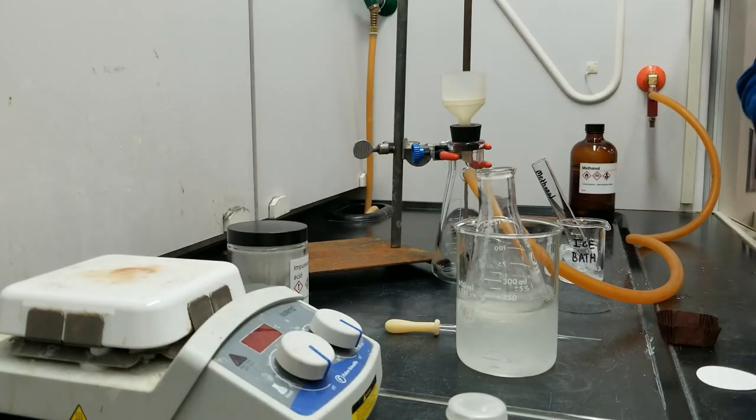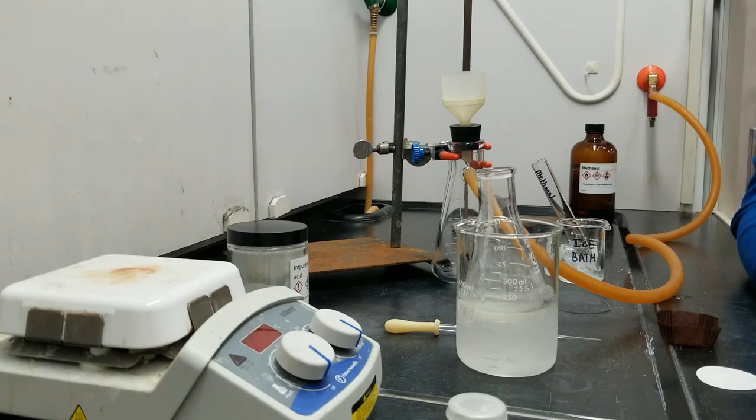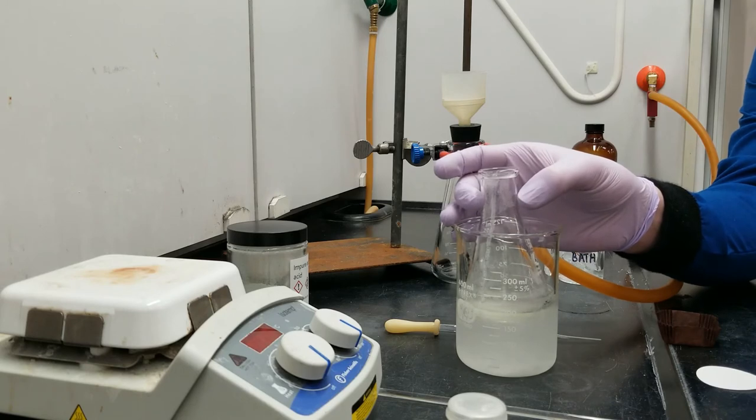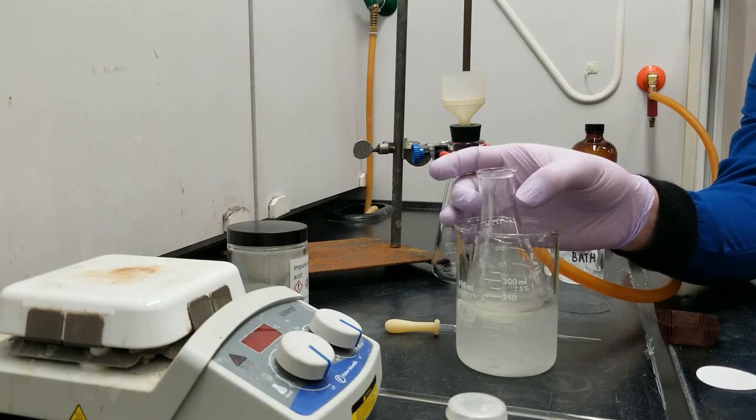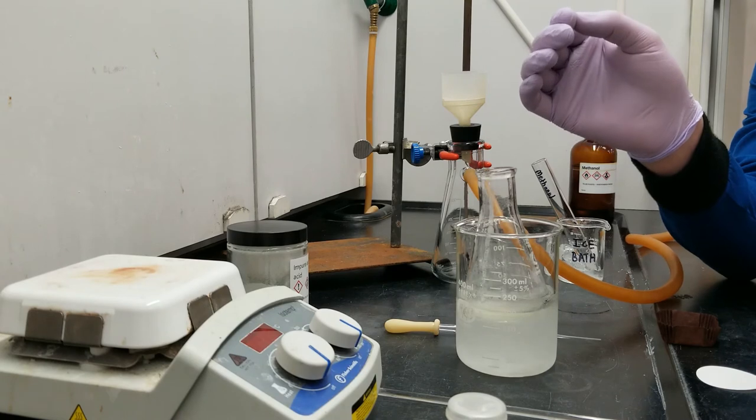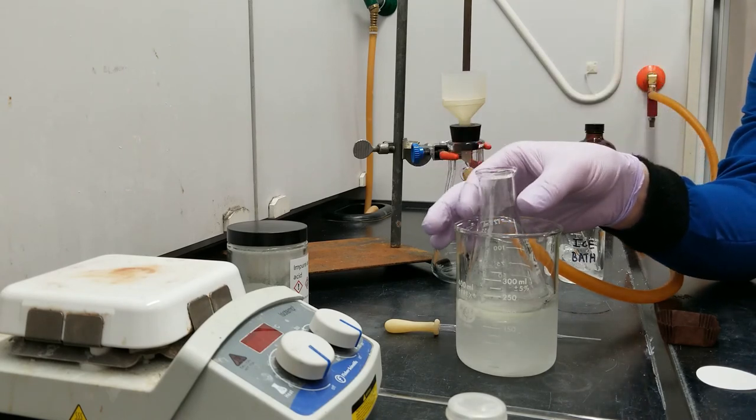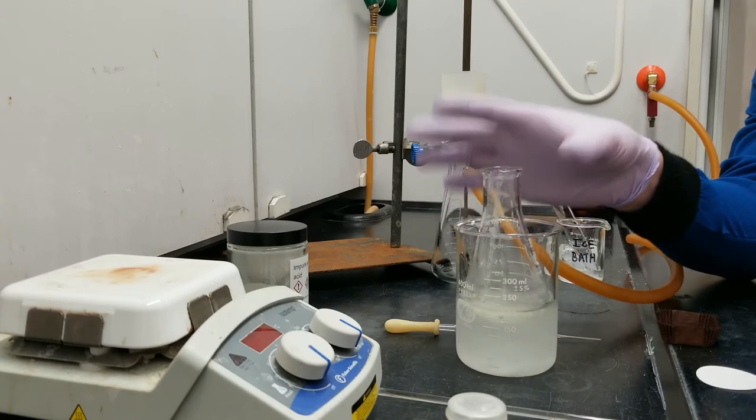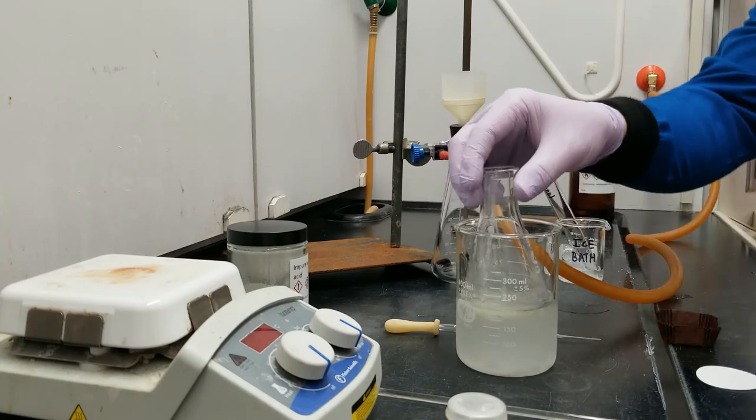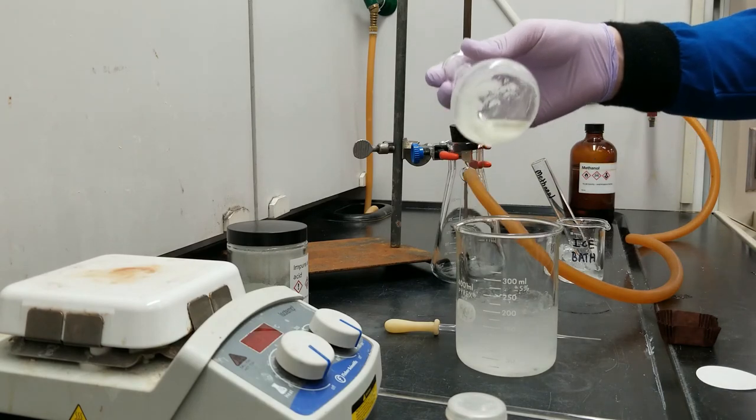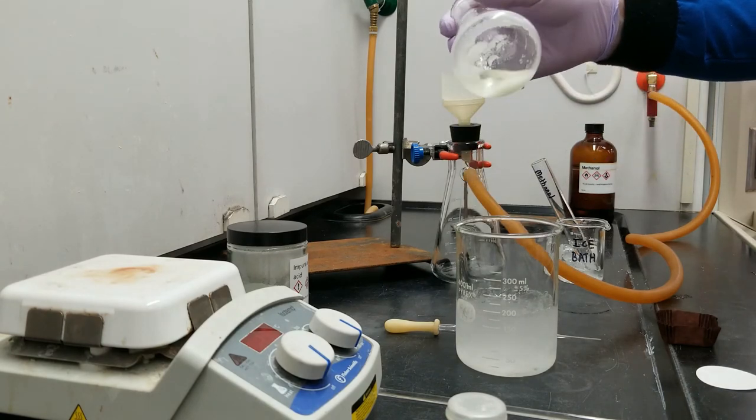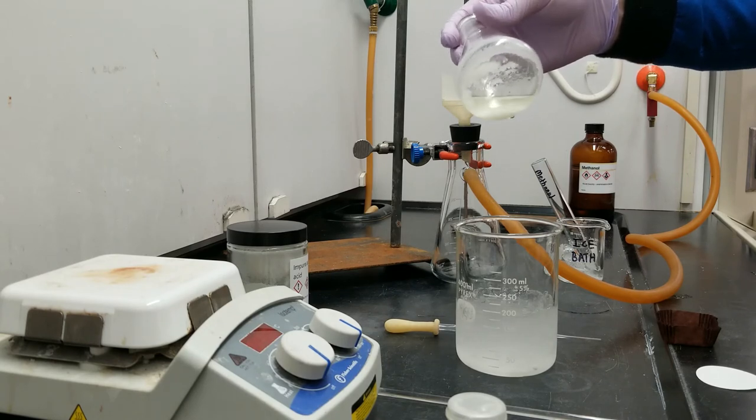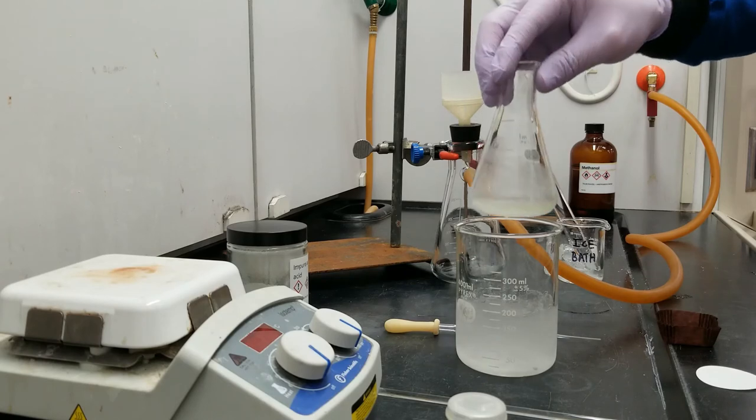Okay, we are back. So, since you've been gone, we had the recrystallization going at room temperature for about 15 minutes. At that time, we started to see some solids form. But we saw many more solids form once we actually threw it into an ice bath for about five more minutes. So here's the situation in the flask now. We have a fine white solid plastered around the inside of the container. And that is our adipic acid.